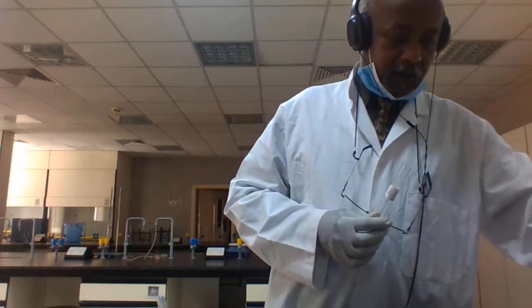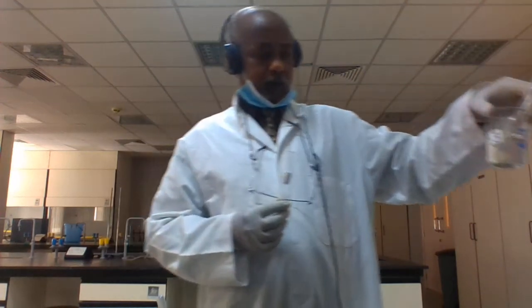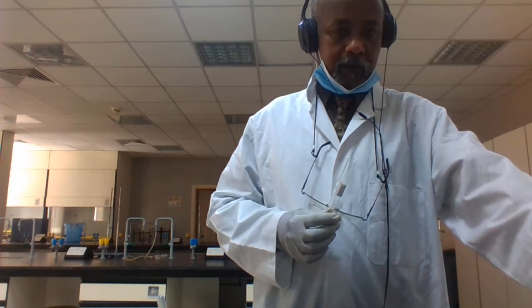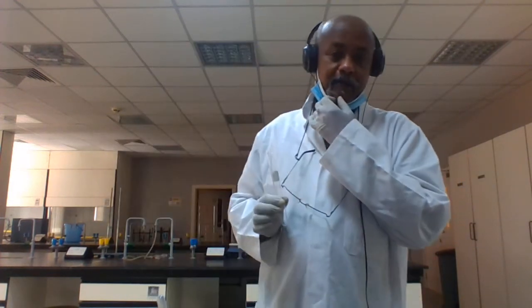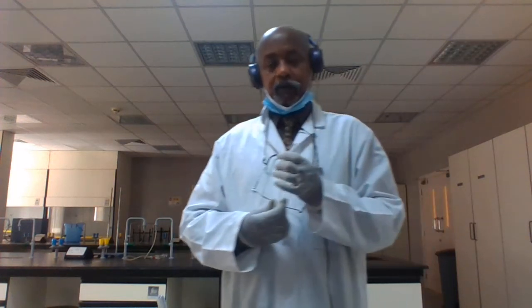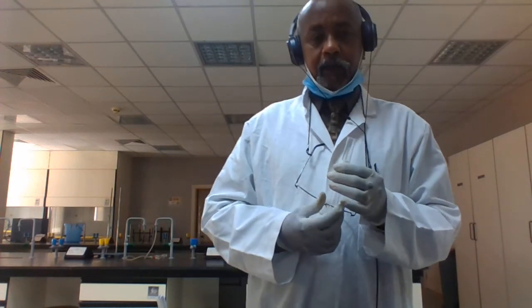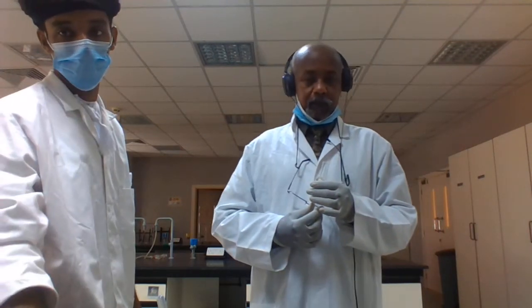Sample 3 was tested, and suppose we have protein in it, and sample 4 is lipids. Then you finish your practical work, clean your area, and that's all for today's experiment. Okay, now we will start doing this practically.